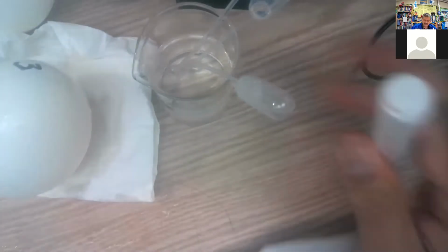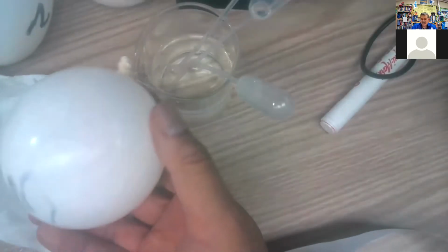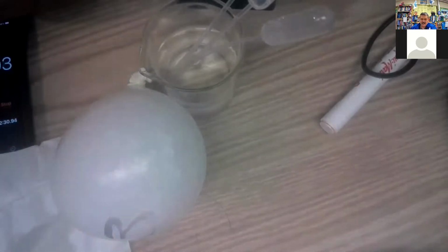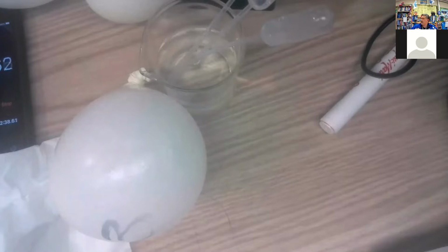Right, so there's the third one right there, and it would have been great if I had been able to hang on to that and not make a mess. See that it's starting to expand. Shake that. We'll take a measurement in just a couple minutes now for the 5 minute measurements. In the meantime, we can set up a table.